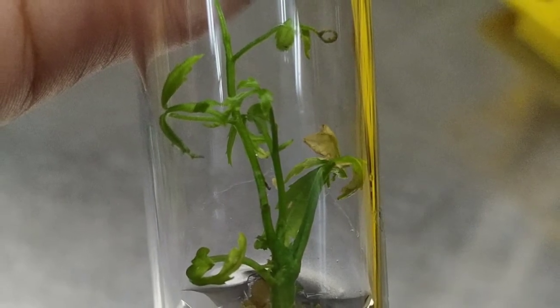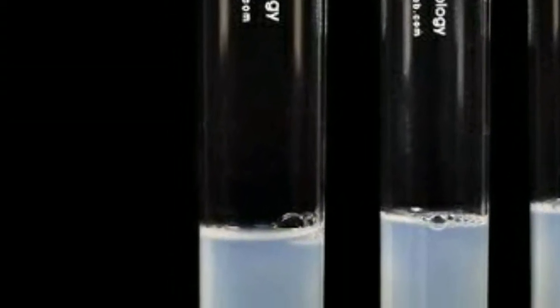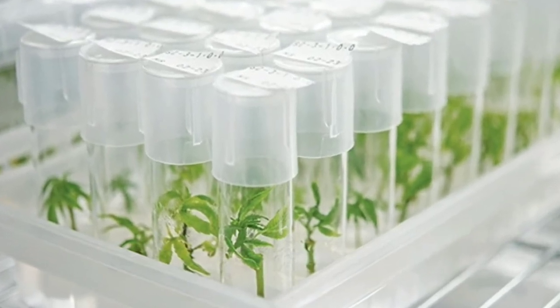At the end of each passage, each axillary shoot which had grown fairly long was cut into single-node segments and transferred to fresh medium for further multiplication. For rooting, terminal 3 cm long portions of elongated shoots with 3 to 4 nodes were excised and cultured on half-strength MS or quarter-strength MS (major inorganic salts reduced to one-quarter strength) supplemented with indole-3-butyric acid in the range of 0.5 to 1 µM. Each treatment was replicated three times with 20 tubes per replication. Data on percent rooting, root number, and root length were recorded after five weeks of transfer to rooting medium.